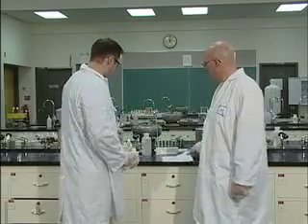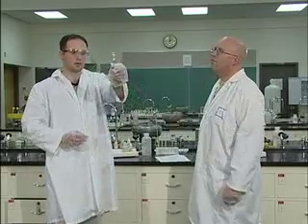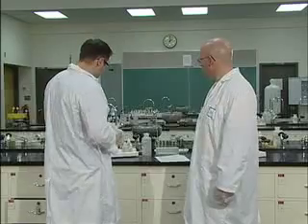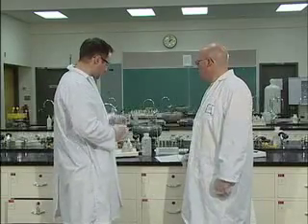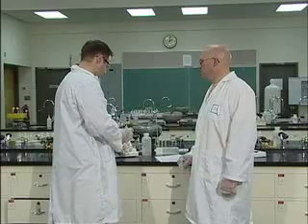Now part B is a little bit more exciting. Single replacement reaction. Again, we have our labeled test tube. In this labeled test tube, we're going to put 30 drops of hydrochloric acid. Now this is 6 molar hydrochloric. Be careful. Don't taste this one. This is a dangerous one.